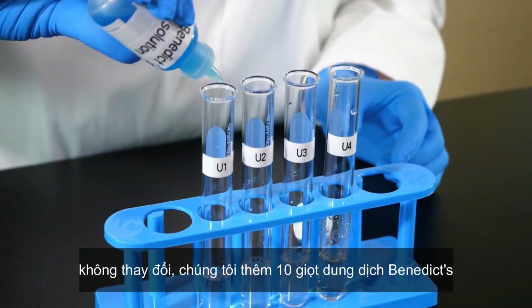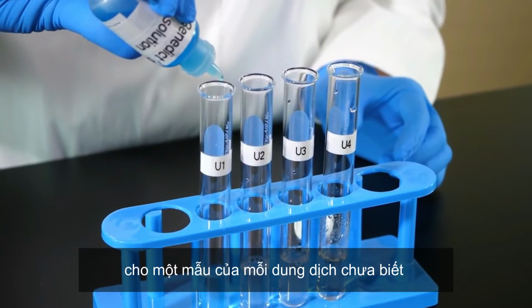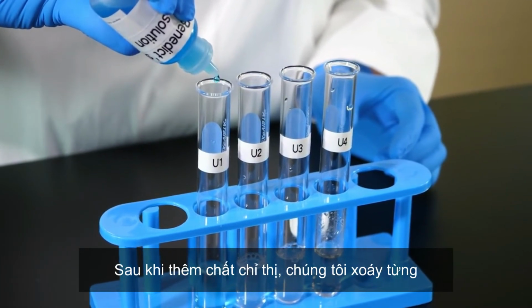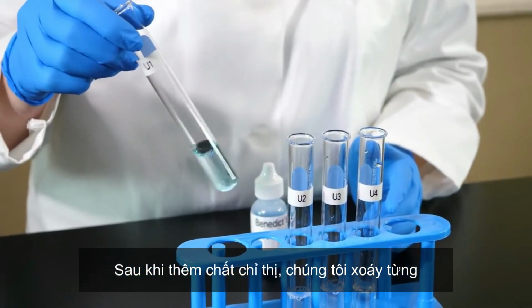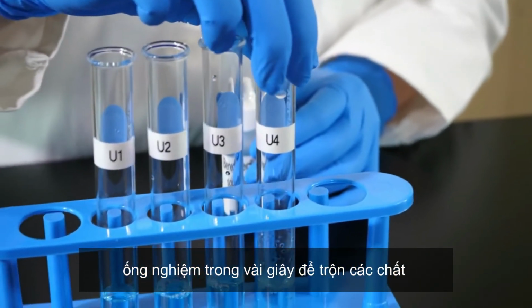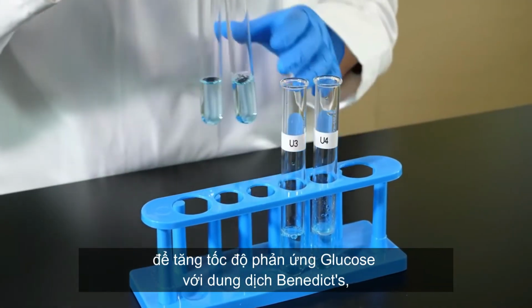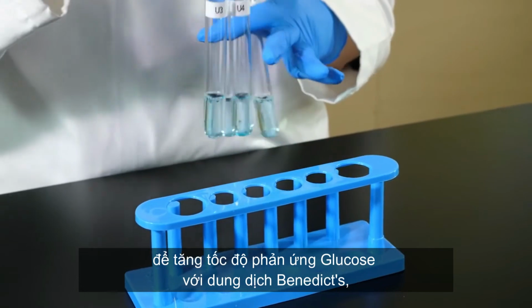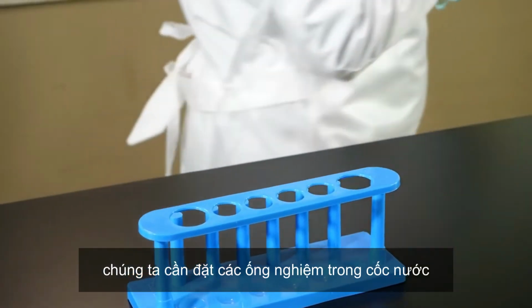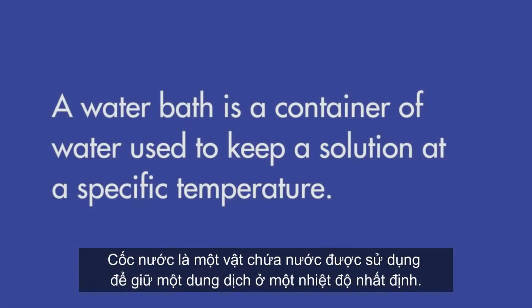We add 10 drops of Benedict's solution to a sample of each of the unknown solutions. After adding the indicator, we swirl each test tube for a few seconds to mix the contents. To speed up the reaction of glucose with the Benedict's solution, we need to place the test tubes in a water bath. A water bath is a container of water used to keep a solution at a specific temperature.